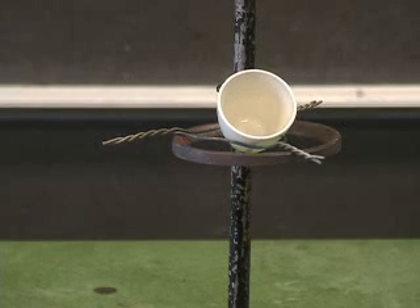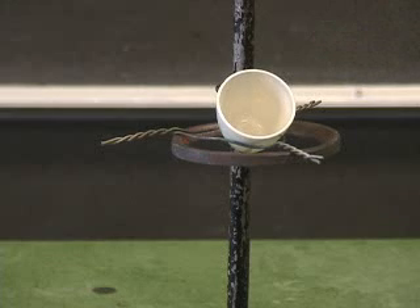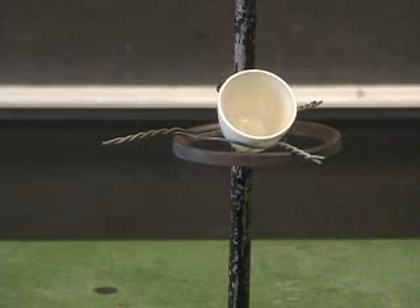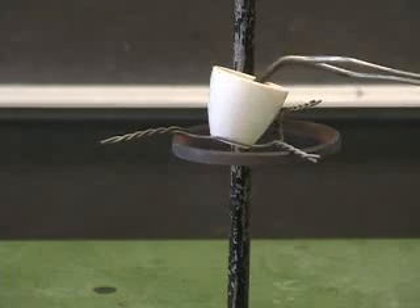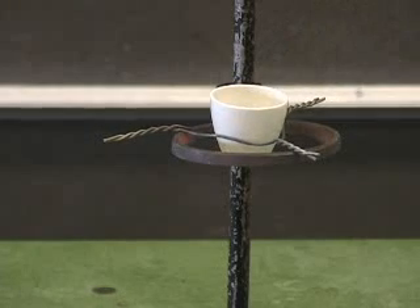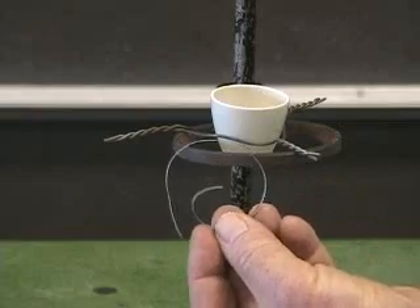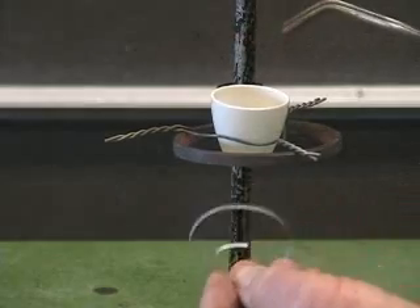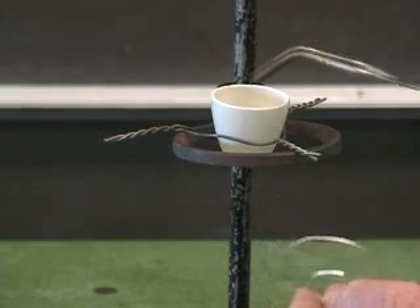I propose to get some data that would allow me to figure out the formula for magnesium oxide. I want to do the reaction just like I did before, only allow the magnesium to react with the air inside this porcelain crucible. By keeping everything that happens inside the crucible and weighing the product after I weigh the original piece of metal, I'll be able to figure out how much oxygen was absorbed into the magnesium compound and from that information figure out the full formula for magnesium oxide.